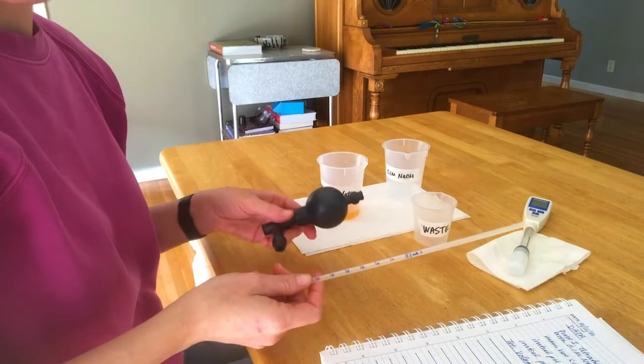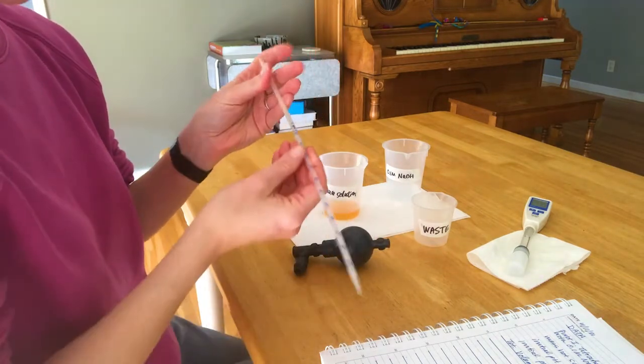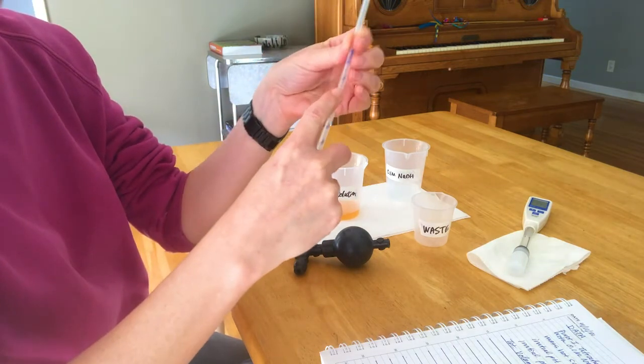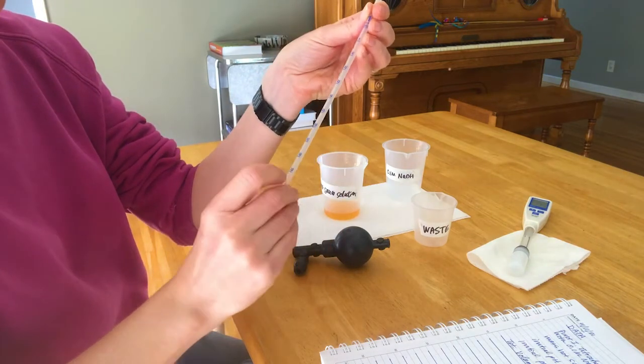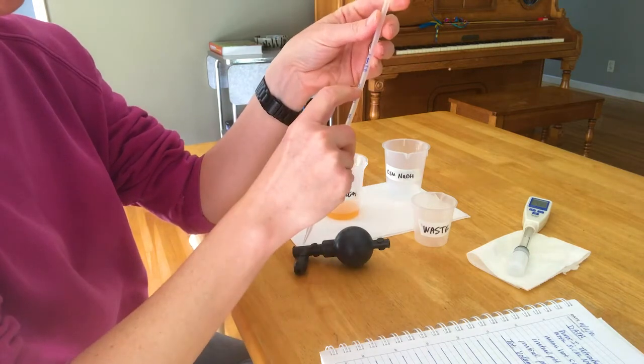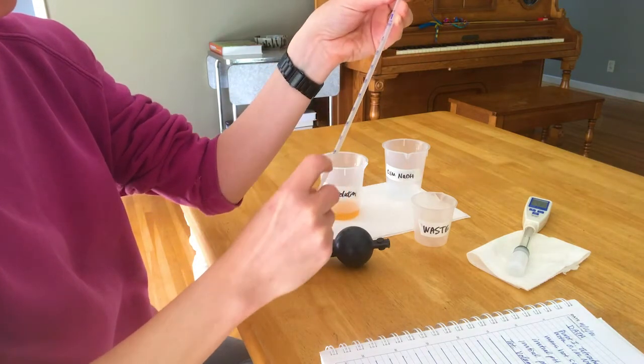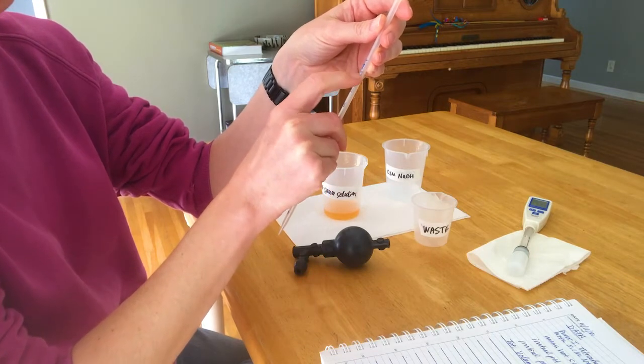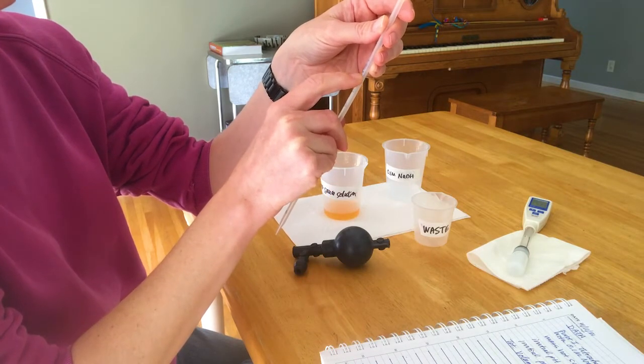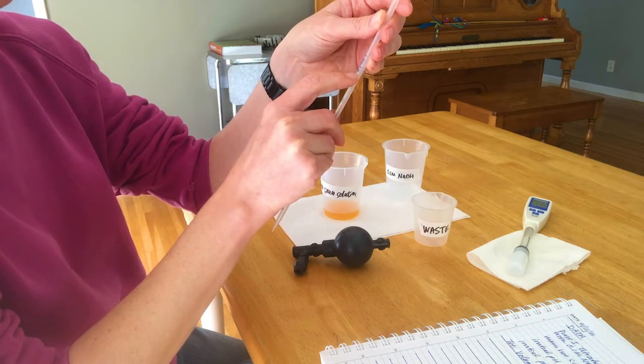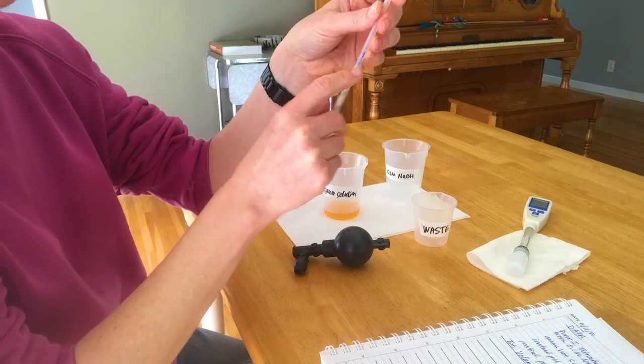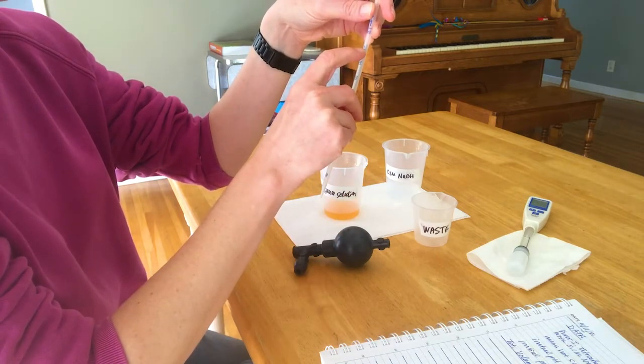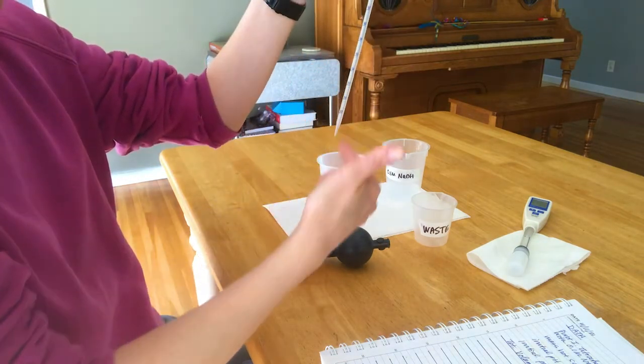I'm going to show you how to use this pipette. First of all, it's graduated, meaning that it has multiple marks on it. At the top it says 0 and then the marks will tell you how much solution you've dispensed. So you want to start at the 0 and either drain it all the way if you want to add 1 milliliter, or if you want to add less than 1 milliliter, you'll drain to that mark. It also says the uncertainty is within plus or minus 0.02. So you should be able to measure to two decimal places the volume.